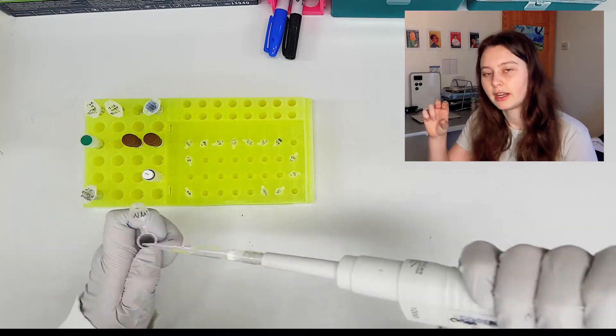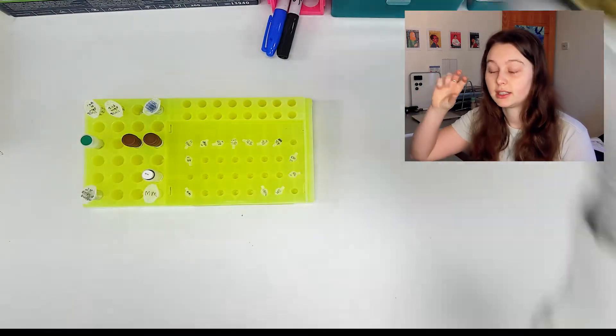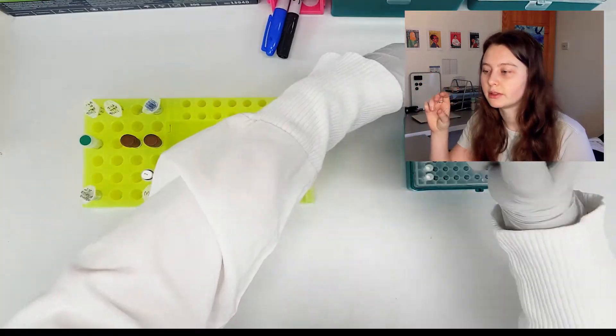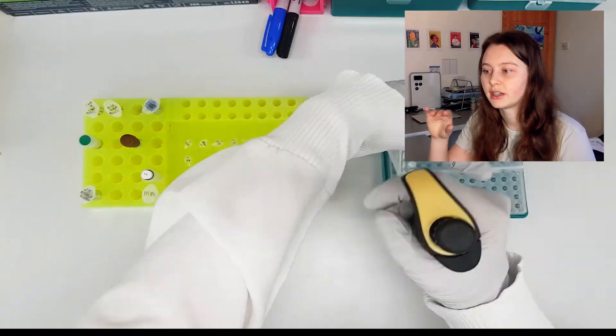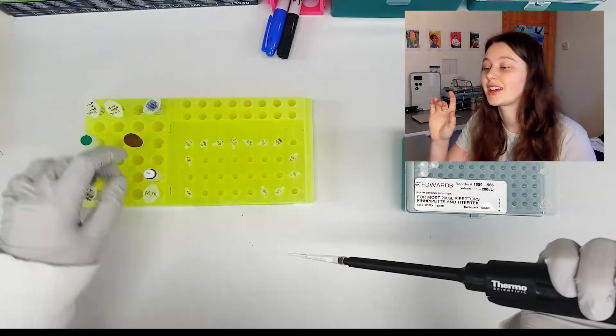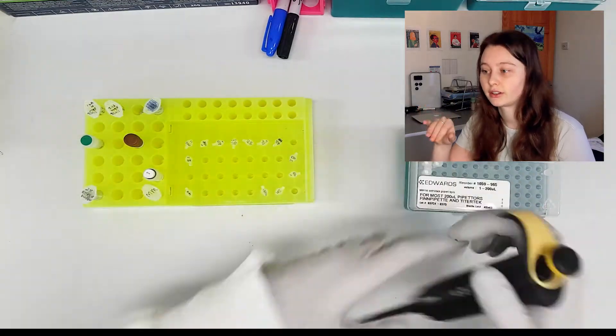I really like having my reagents for a single experiment in a single freezer box like this yellow one, so I can just pull it out and get started and I've got all the right concentrations of my reagents. So the concentrations I actually use of my reagents go here.